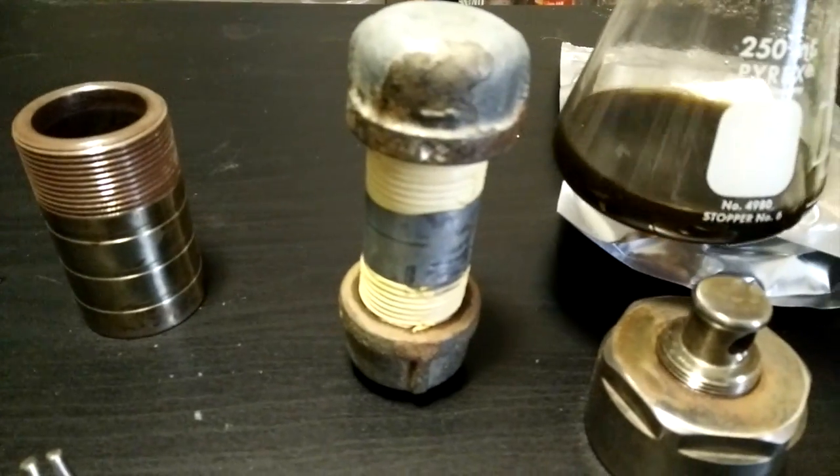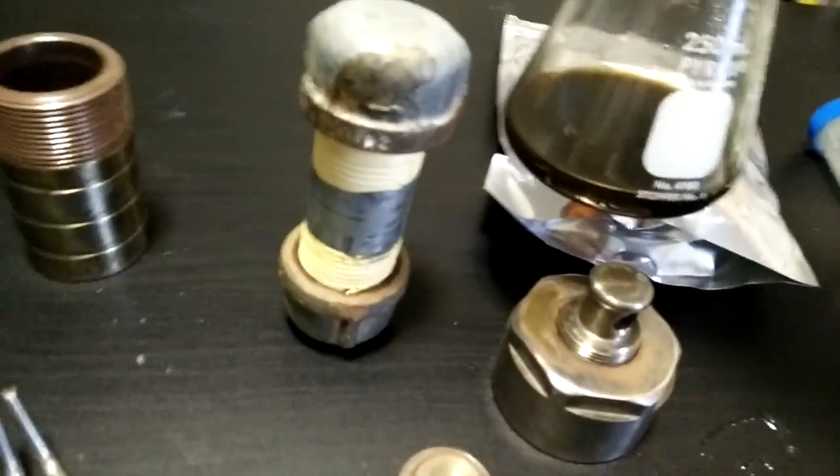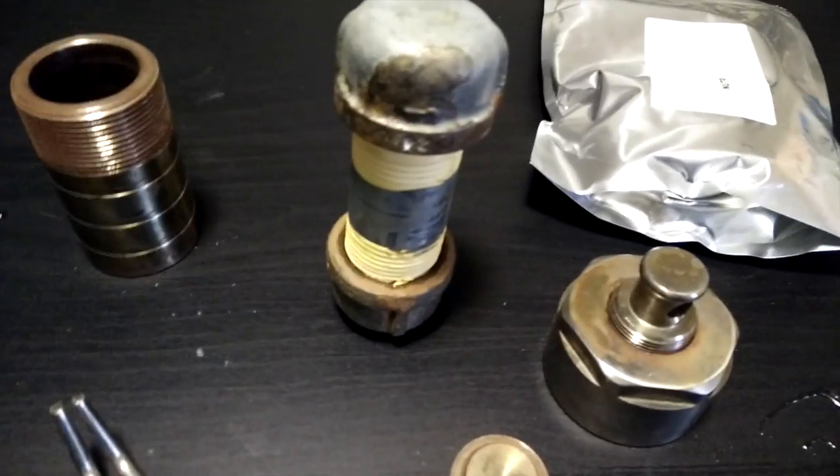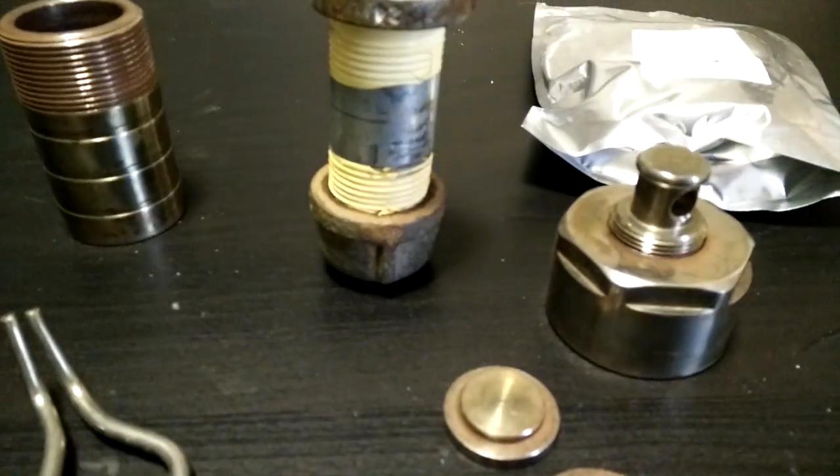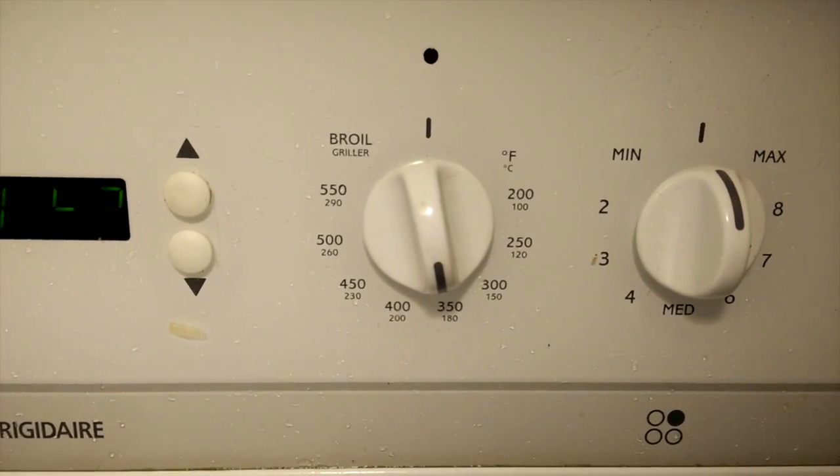Then load it into a hydrothermal reactor. I showed and explained both of these in a previous video and then load it into an oven at 180 degrees and leave it for 10 to 24 hours.